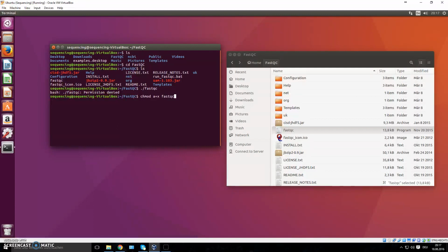You could now just type in fastqc, and another faster method is to say that I just want to give every single thing in this folder the rights to do that. And you do that by just using a star, or an asterisk, which is called a wildcard in Unix. So a wildcard can be anything. If you write the star and then write down QC, now all the files that start with whatever but end in these two letters will be included. That's some neat information. It's going to save you a lot of time later on. So we just use this.